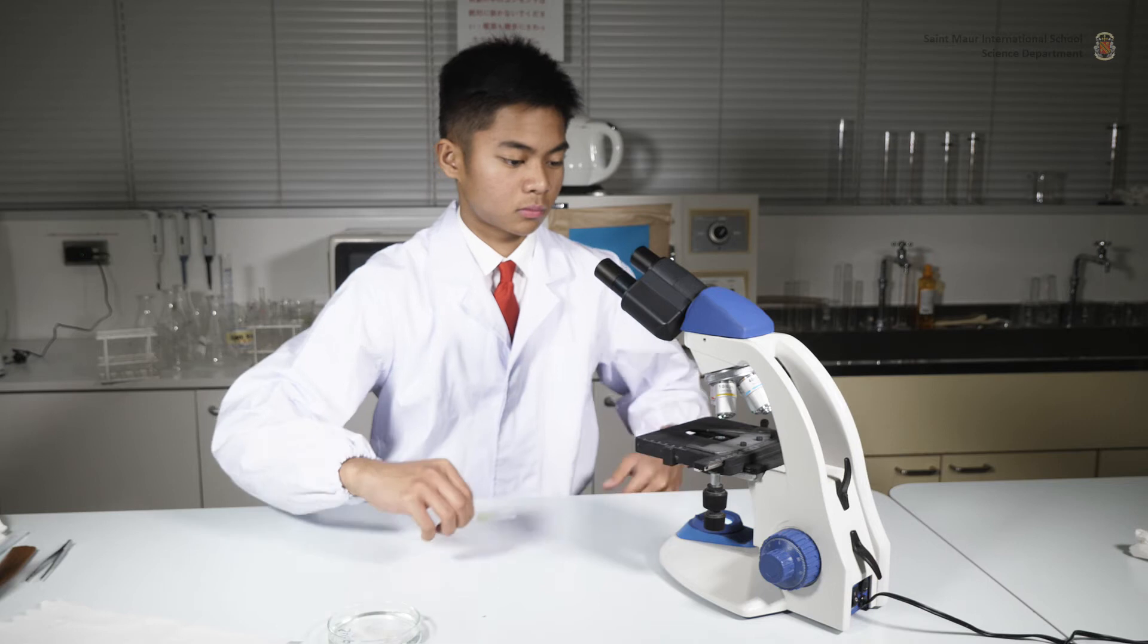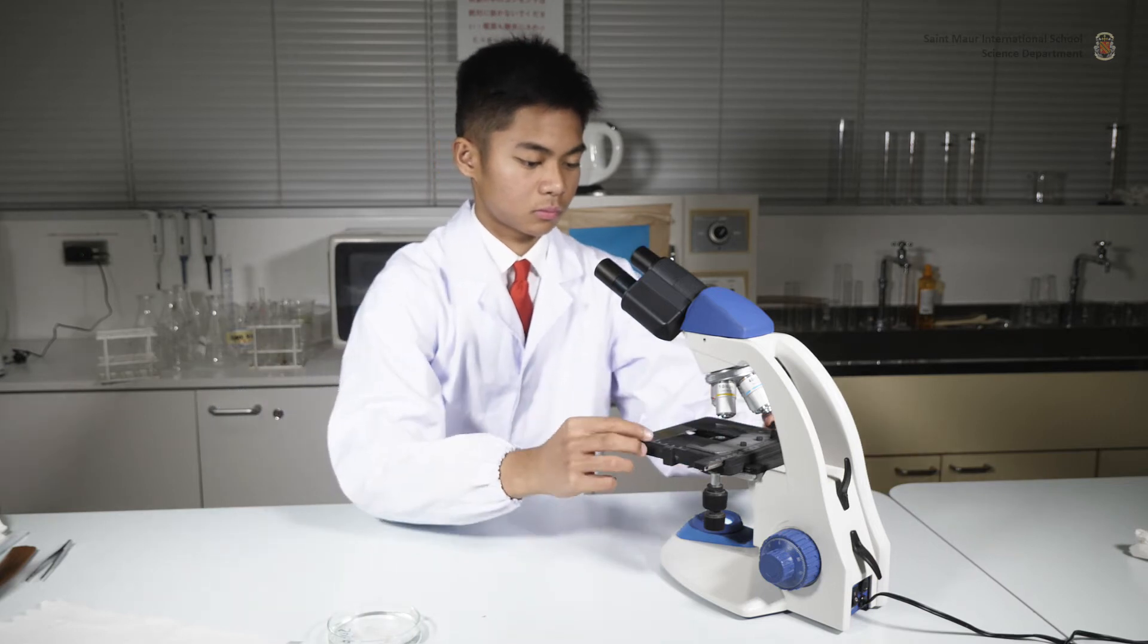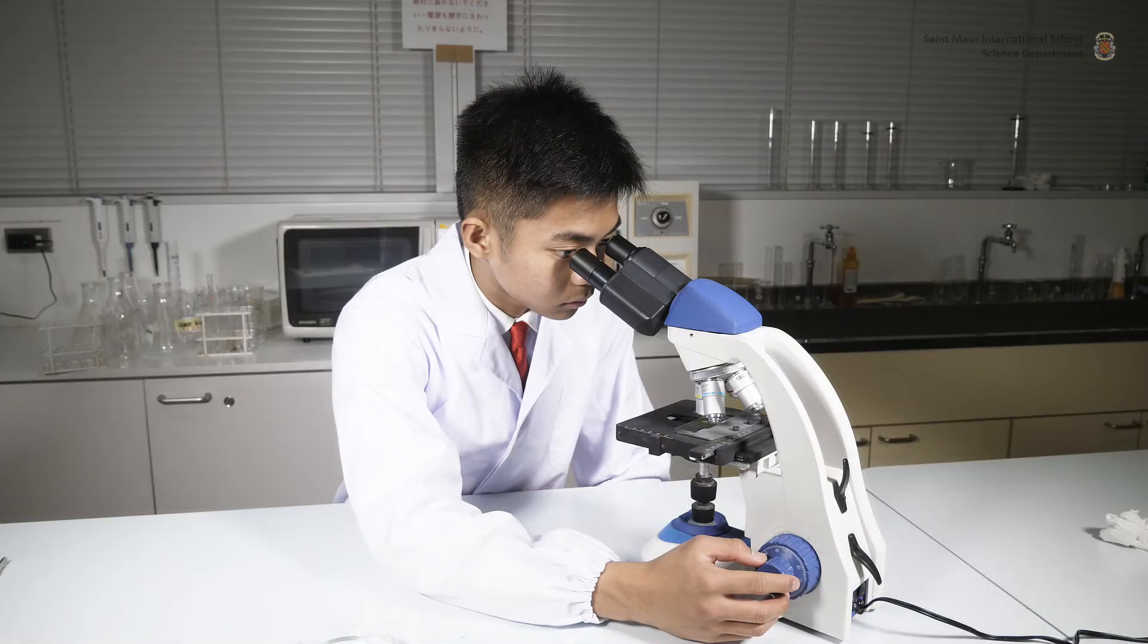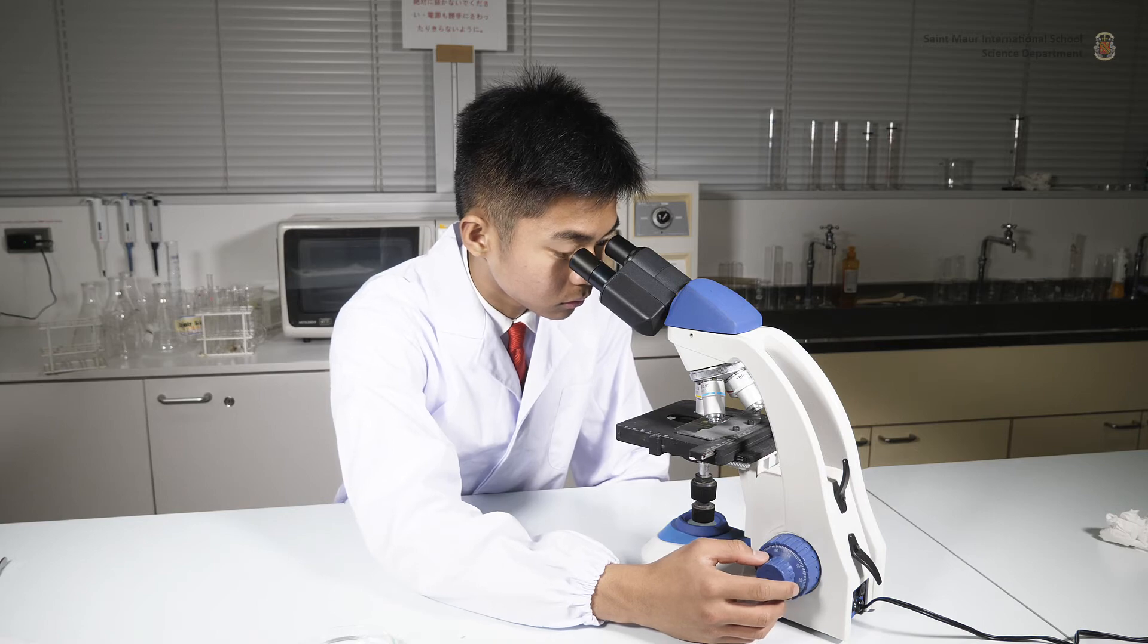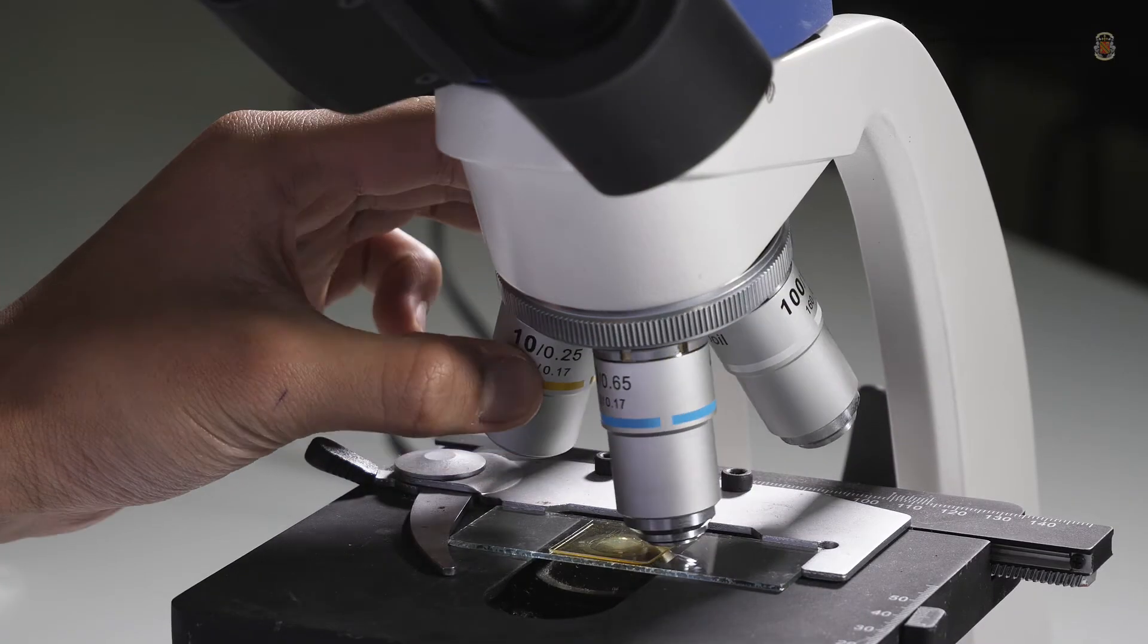Immediately observe the sample under a light microscope. Use the coarse wheel to bring the stage up and the fine wheel to adjust focus. Move up magnification power as needed.